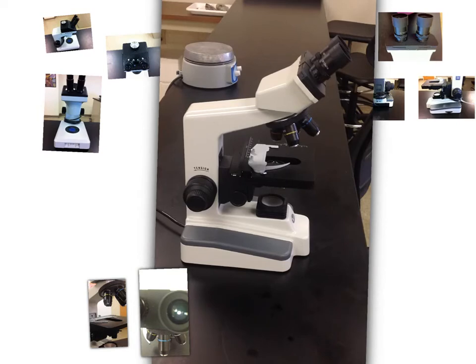What you see here, we have our coarse adjustment, and then we have our fine adjustment. Our coarse adjustment you're going to use on the lowest objective, and then on the medium objective. Once you get to the higher objective, you will not use your coarse adjustment. Here's our lowest. This is 4. Then we have our 10, and then we have our 40. We also have a white one, which is 100. We're not going to be using that this week in lab, because that's for oil immersion, and we're not going to be using oil.